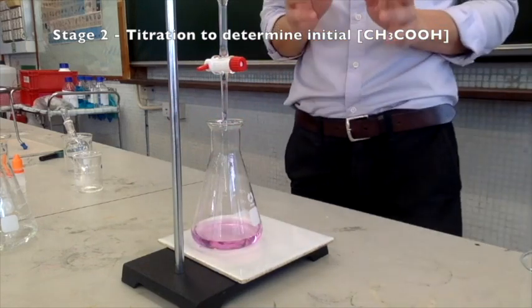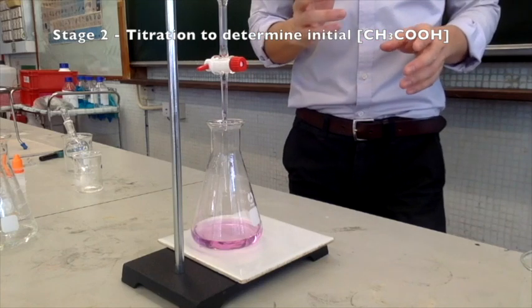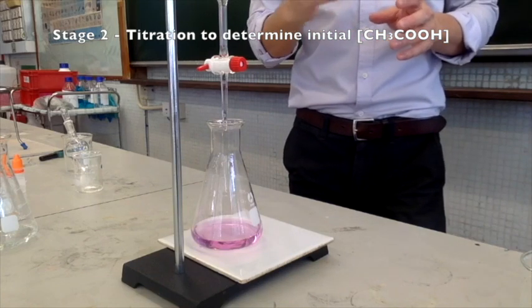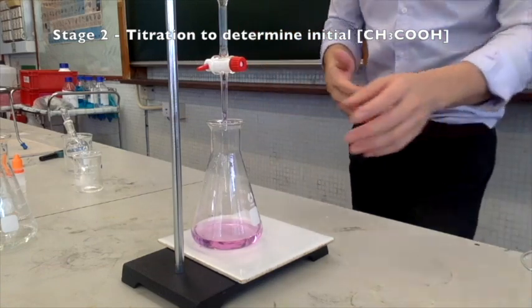Now, a tip for you: you can actually do some calculation before you carry out the titration in order to find out what the approximate endpoint is. Okay? Of course, you can also rely on the first trial, which is a rough trial.